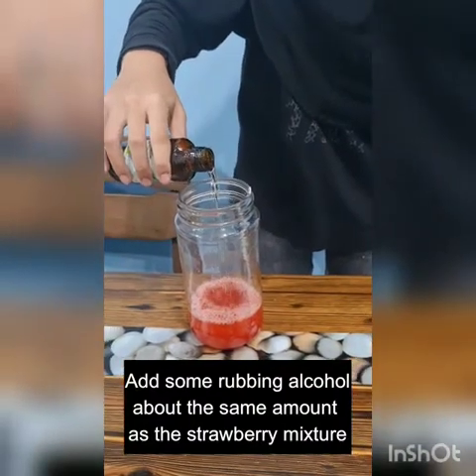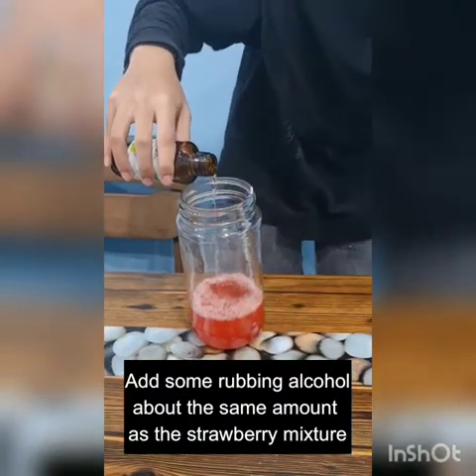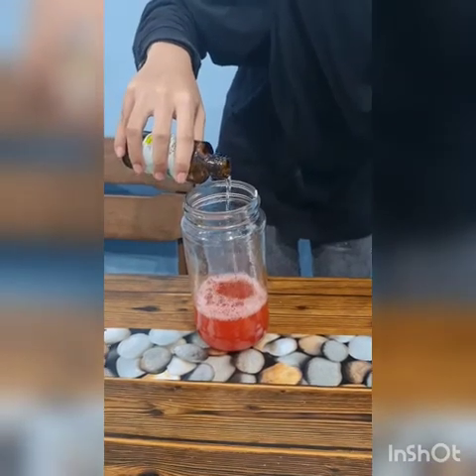The alcohol is added, the same amount as the strawberry juice, and that's it for a while.